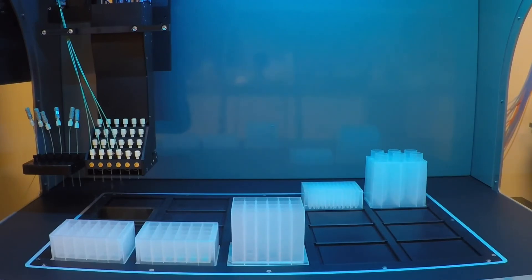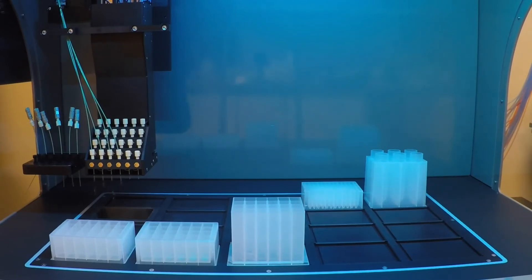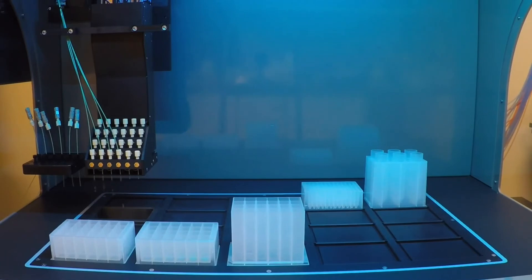And then push to port 9, which is the port that the columns are connected to. The robotic arm is positioned at the waste position so that the wash fluid coming through the columns goes to waste.